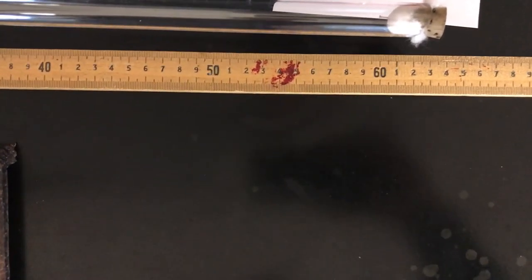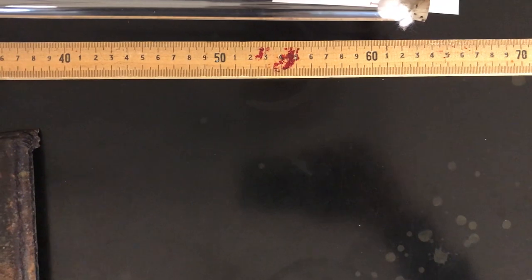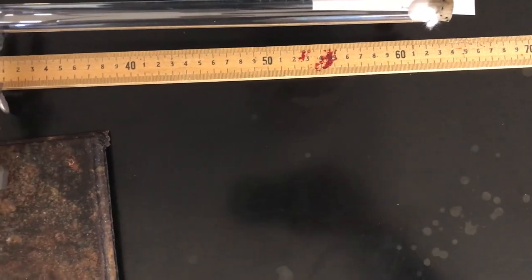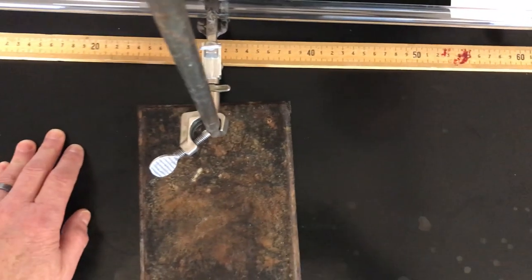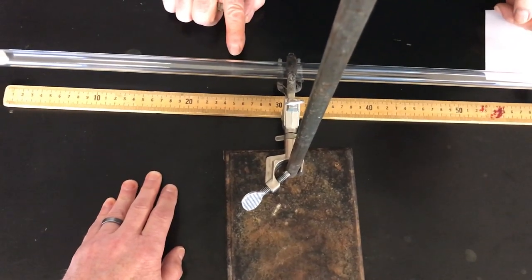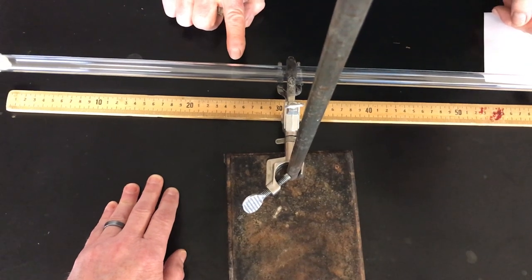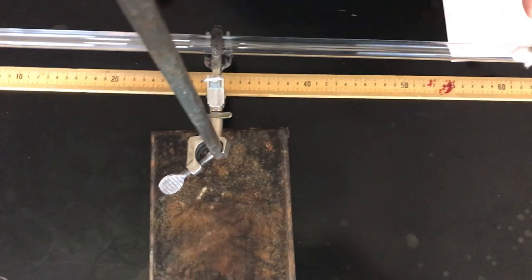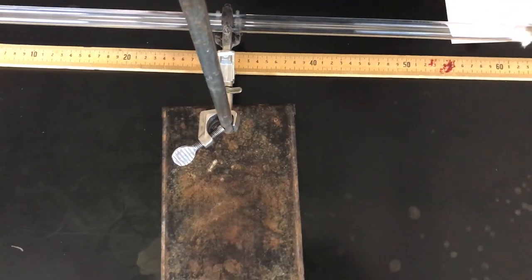Does my mental math write for the ammonia? What does that get us to, about 62 or so centimeters? Yeah, 61 and a half-ish, if I go right to the end of the tube. Okay. So, 61 and a half minus 25 and a half. 36 and a half, is that what you said? I think so. Or the halves cancel, so. 36.